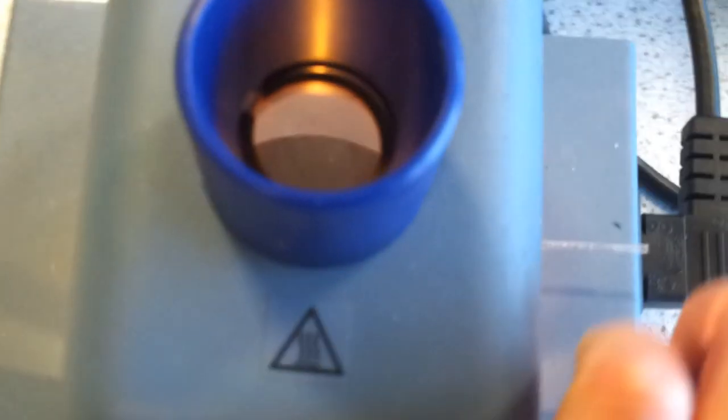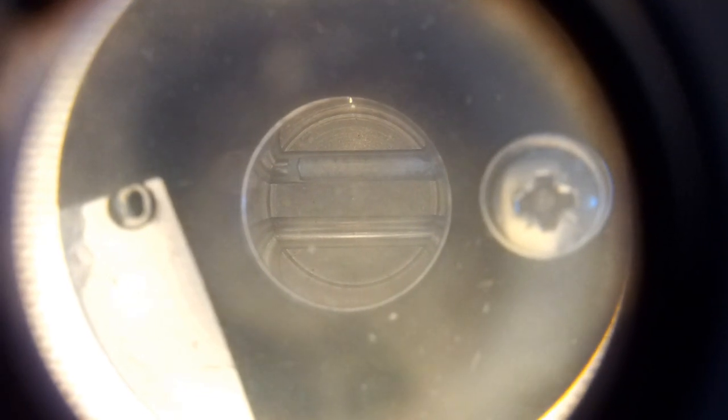And when you look from above, when the camera focuses you can see the white powder in there.